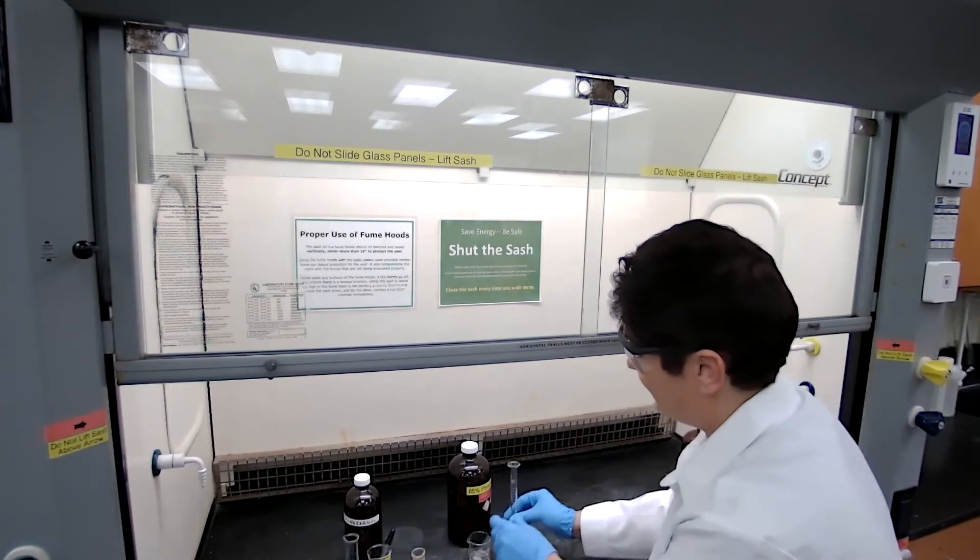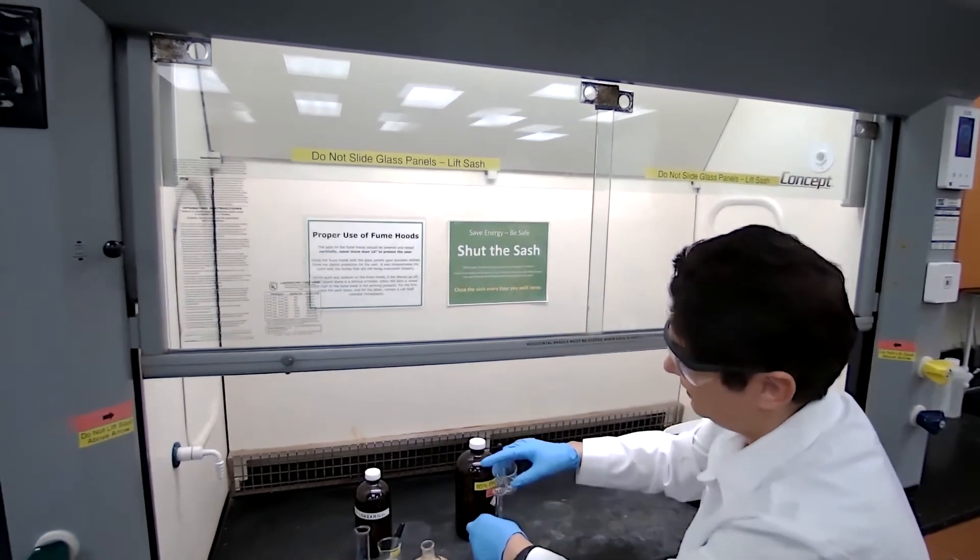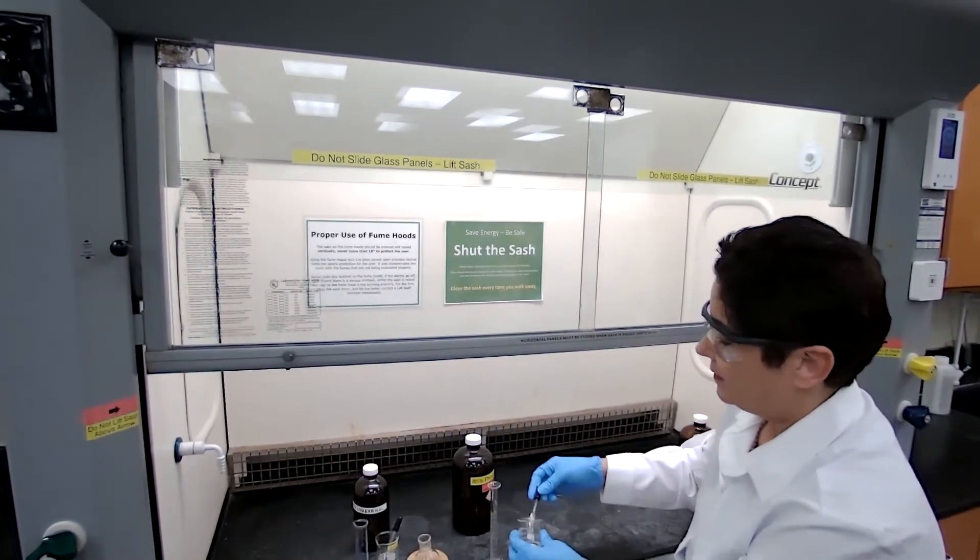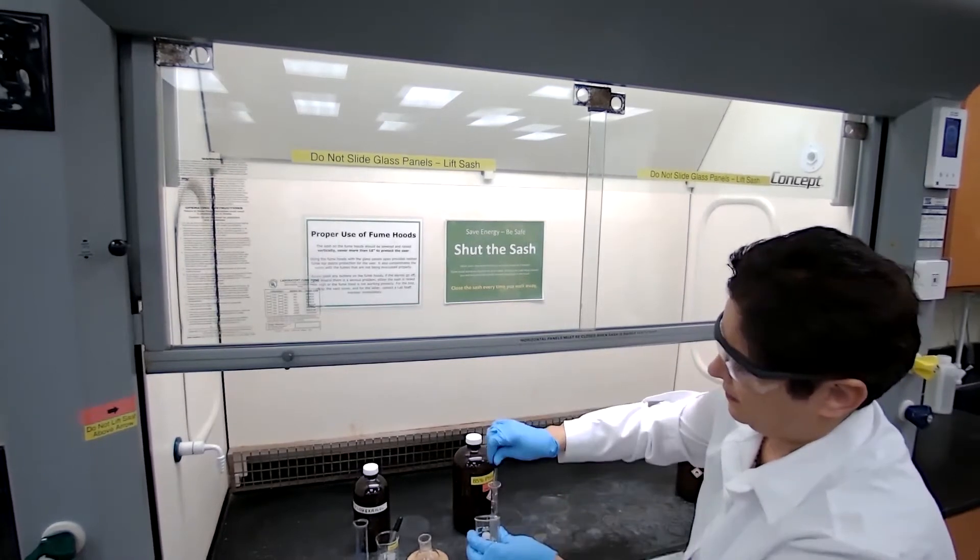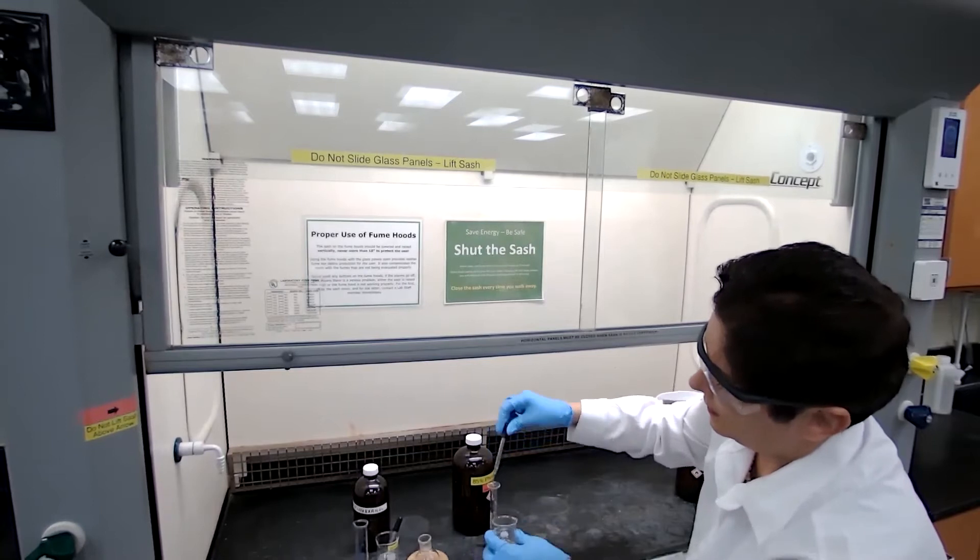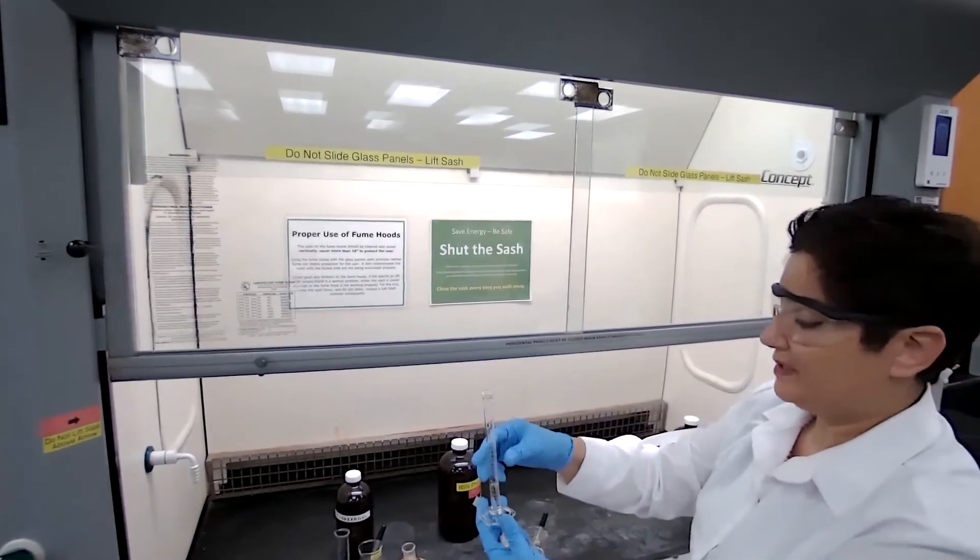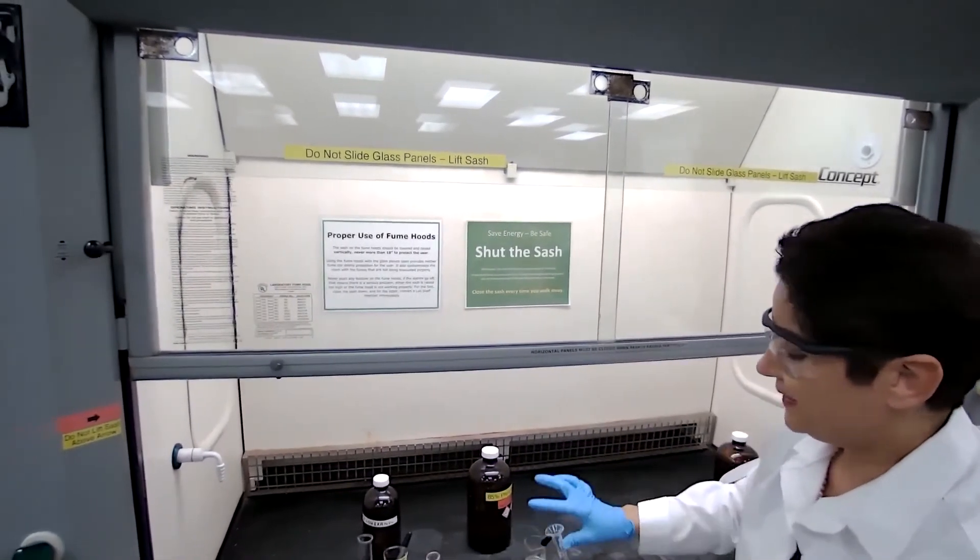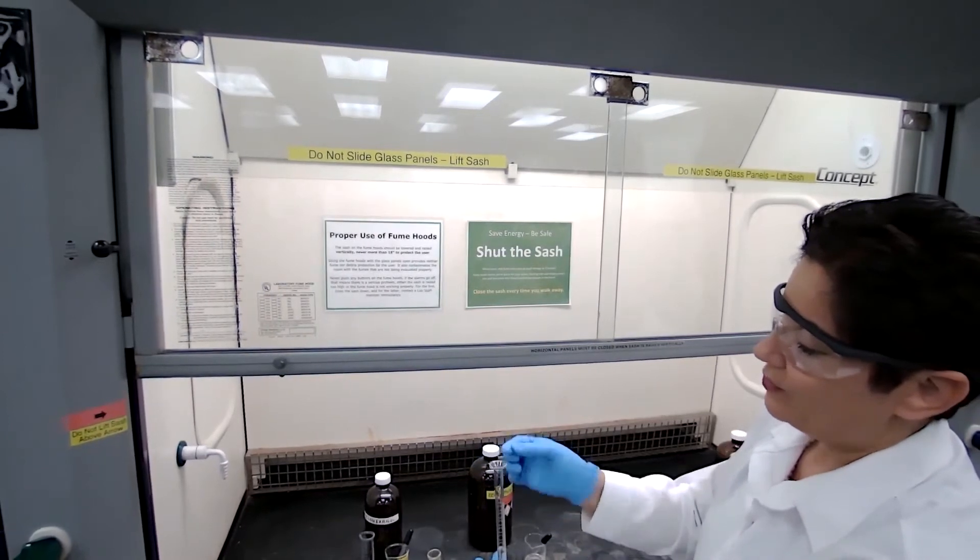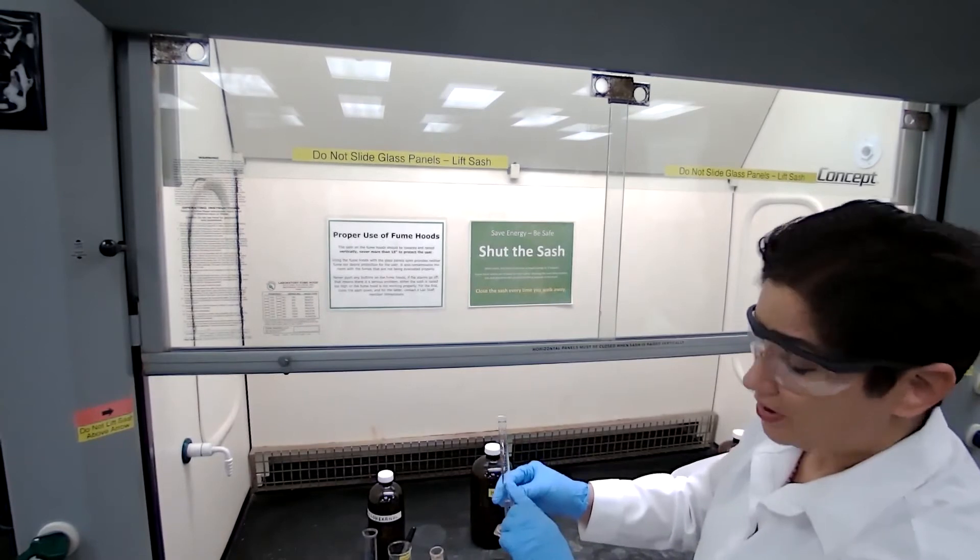We are going to add the phosphoric acid, 3 milliliters of phosphoric acid. I don't want to spill any of the acid outside and I don't want to touch the acid.